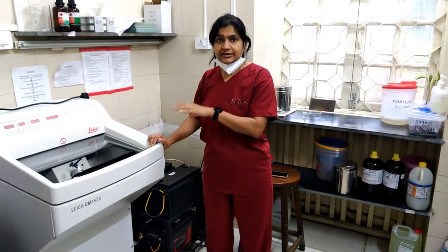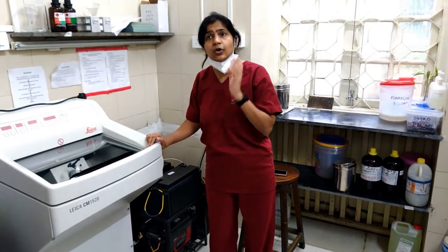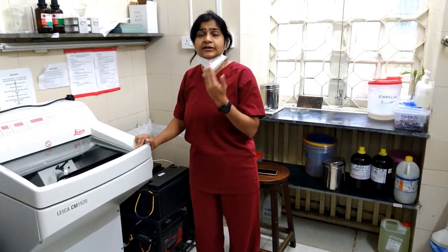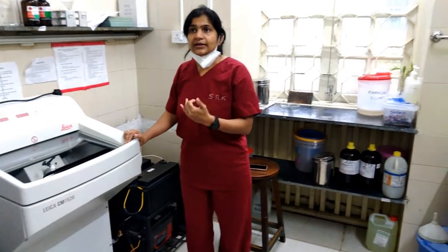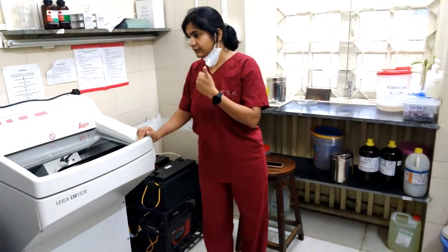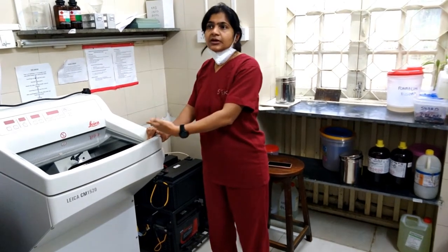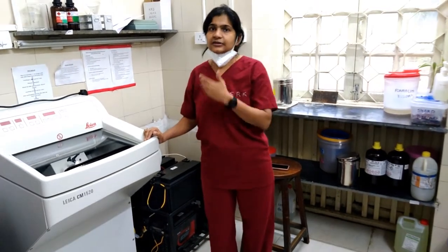Presently, the pathological analysis of muscle disorders is happening only in Bangalore from all over India. So patients have to go there, stand in queue, attend the OPDs, and then get the biopsy and diagnosis done. Here at Wadia, we can do the diagnosis using this device. We have standardized two pathological tests which we will be introducing within the next one month — a diagnosis of muscle disorders not available anywhere in India other than one place.